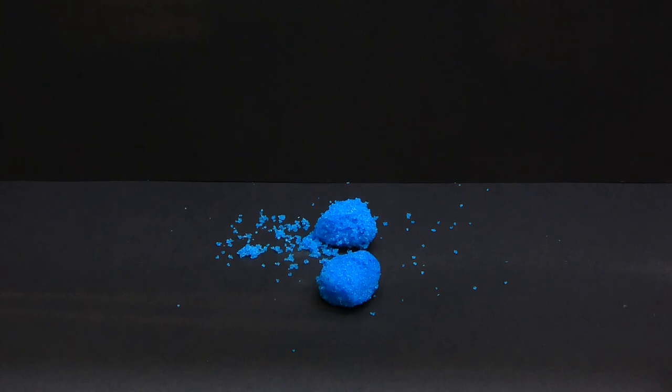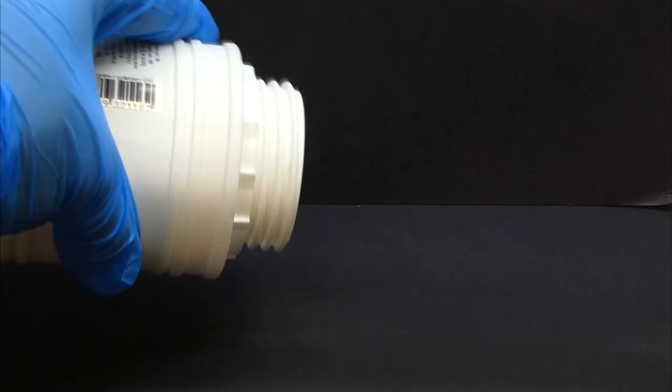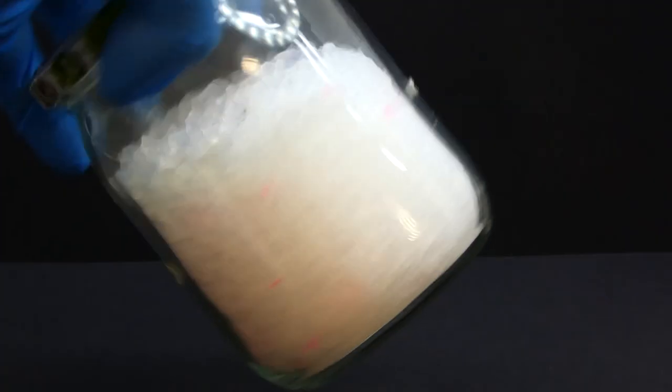To prepare the experiment, we first need to make the sodium silicate. It is really simple, and to do that we just need some sodium hydroxide obtained from a drain cleaner and a source of silicon dioxide, such as silica cat litter or some silica gel drying pellets.